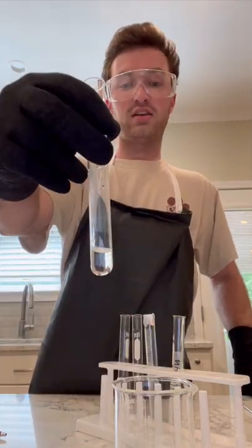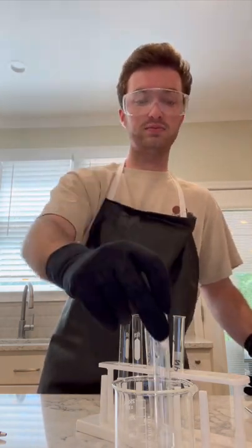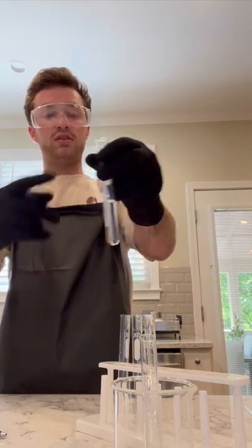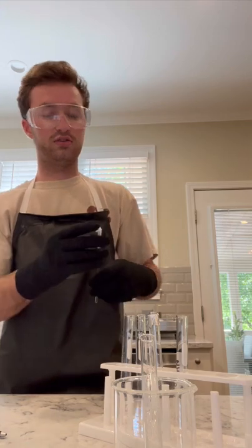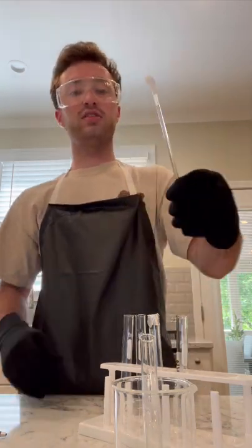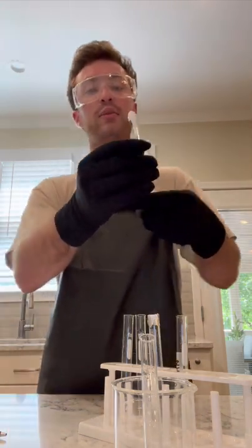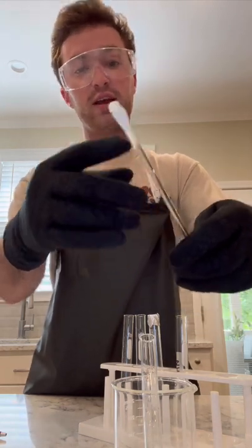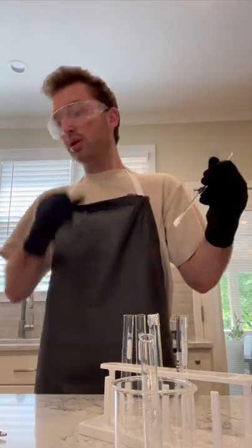But I started off by getting 2 milliliters of the hydrochloric acid, went ahead and measured it out to save time. I am going to leave that right there for now, and I'm going to take my NH4OH. I went ahead and took the precaution seal off of it, because I'm going to be using it. I'm going to be sticking a glass rod with filter paper on the end of it. Online it says use a rubber band, but I do not have a rubber band in my premises, so I used a very small piece of tape to tape the end of the filter paper to the glass rod.